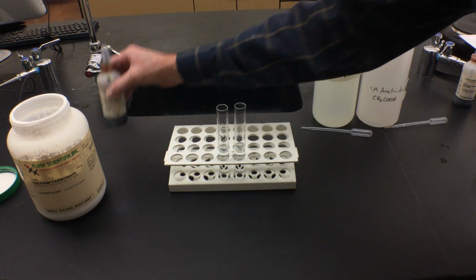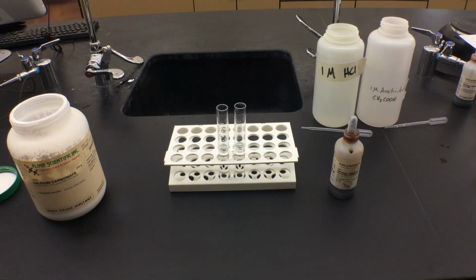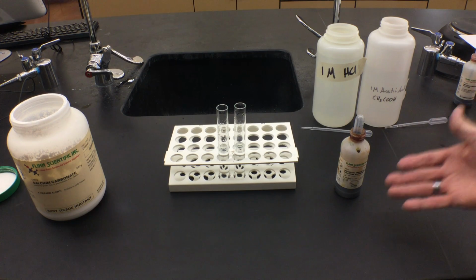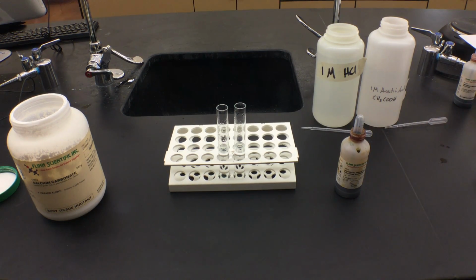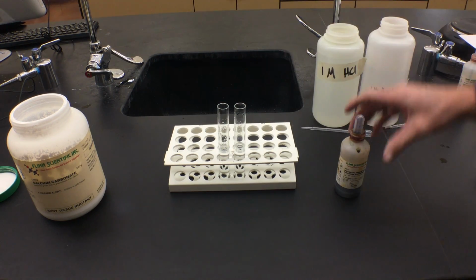Now what I'm going to do is add what's called the rainbow stain. It's called the universal indicator or the rainbow stain because it actually changes color based upon the pH. Again, this is a dye, it's a stain, it's an indicator. It can help us determine something that's an acid and a base. It's color coordinated. The warmer the colors, the more acid it is. The cooler the colors, the more base it is. So I want to demonstrate this a little bit with these two acids. Again, hydrochloric acid, and this one here is the vinegar.